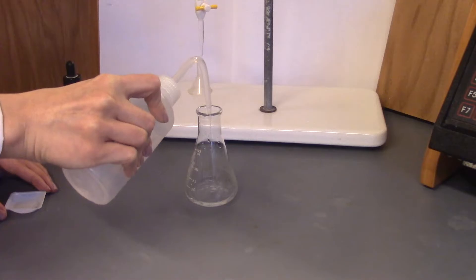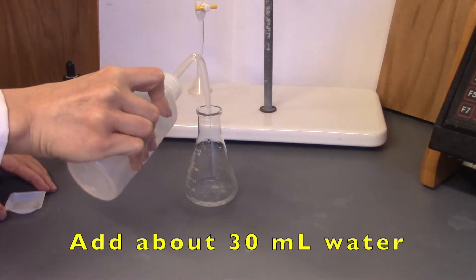Add about 30 ml of deionized water. Again, the amount of water is not important.